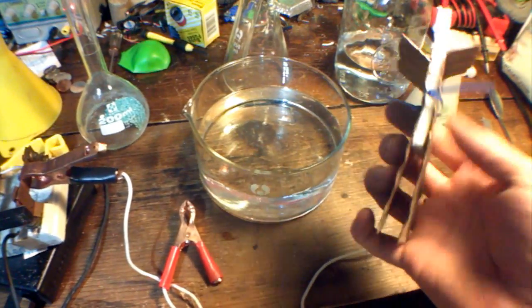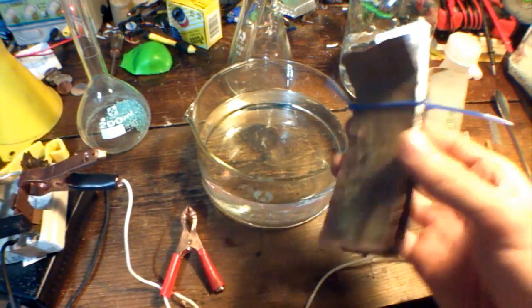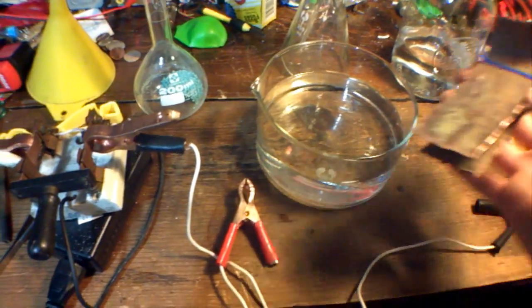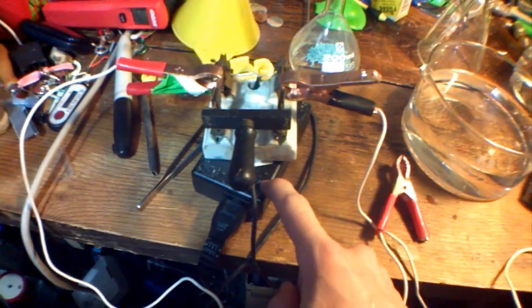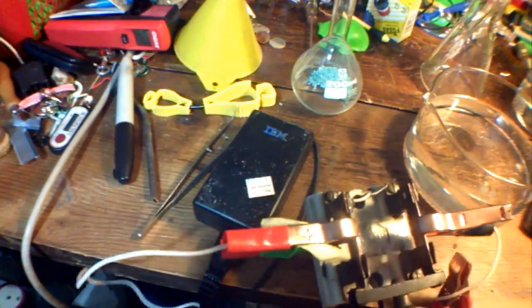Finally, what we need is a copper electrode and anode. I have these two separated by a piece of foam core board and zip-tied together so they're really close. I have a 16-volt, 3-amp laptop power supply from an IBM ThinkPad.